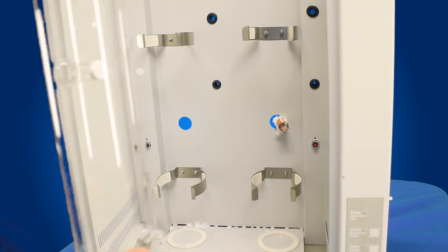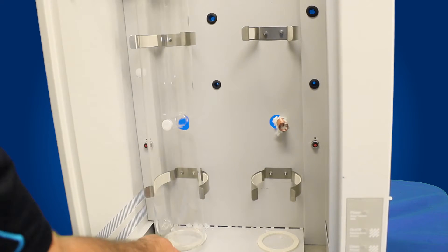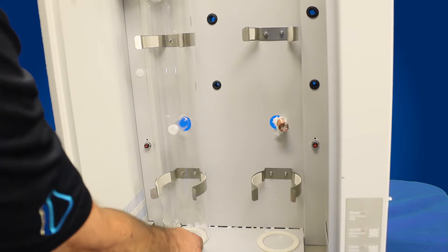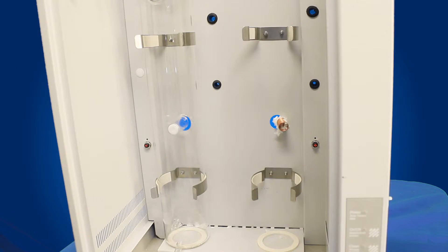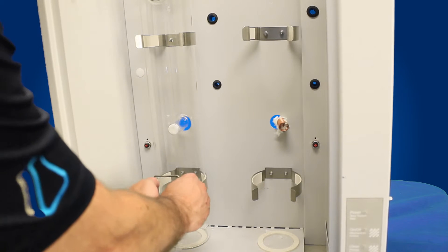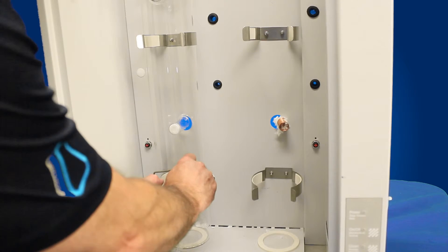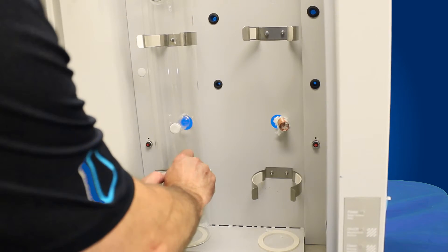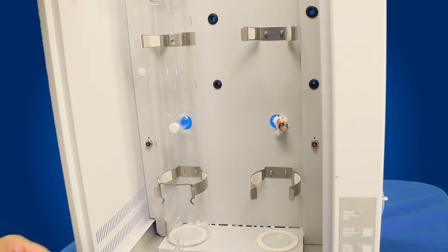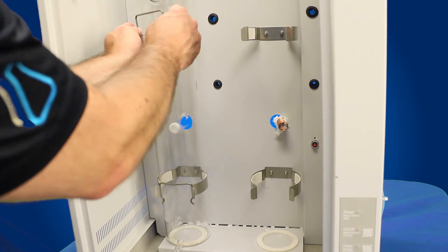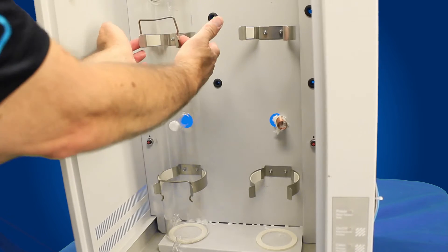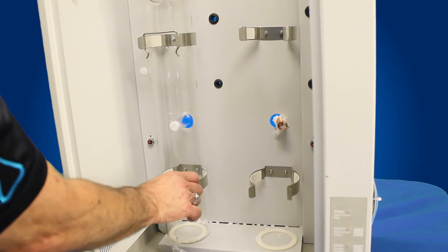Now that we removed the old boiler, we're going to slide in the new boiler in the same spot. Simply push it down, push the two clamps apart, let it sit down on the rubber o-ring at the bottom. Take our two stainless steel clamps. It's got a curve to it. Make the curve go away from the boiler so it's with the same curve of the boiler. Put the two of them over the clamp to get them started. Then just simply push straight down on both ends. Same with the top. They're in place, they'll hold the boiler in place.